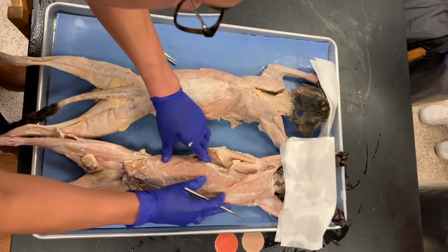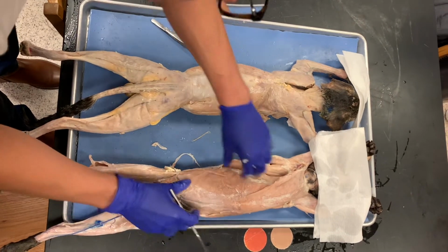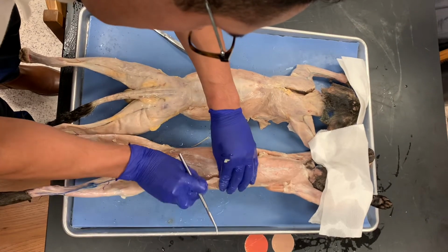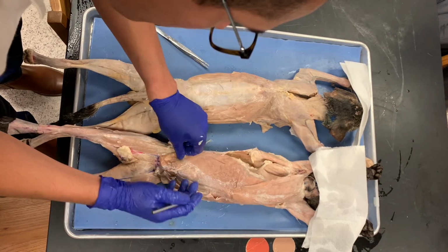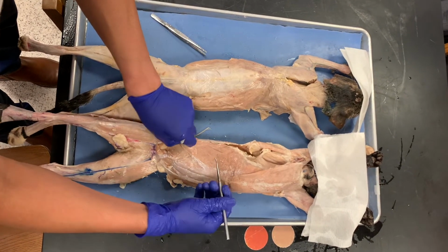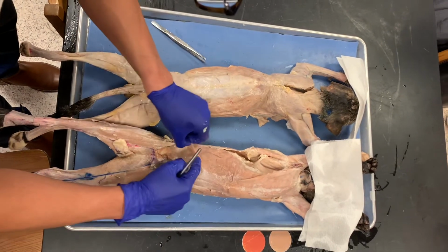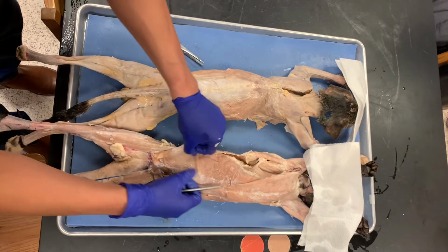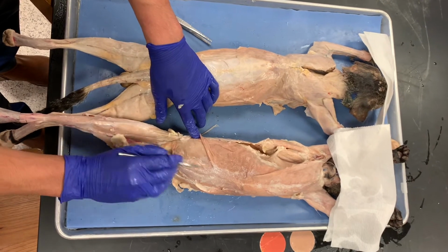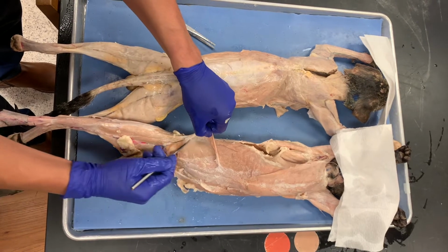So then let's work our way downwards and look at some of the abdominal muscles. If you look at it, let's see, where did I reflect it? Yeah, so we're going to identify the external obliques. The external obliques are here on the outside, and they call them obliques because of the angle. If you look at the way that the fibers run, you can kind of see it here, but on the internal oblique it's really obvious there. So see, the striations are going at an angle. So external oblique is here, this is the internal oblique.